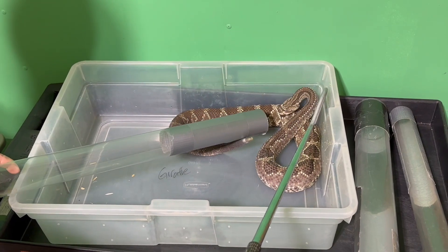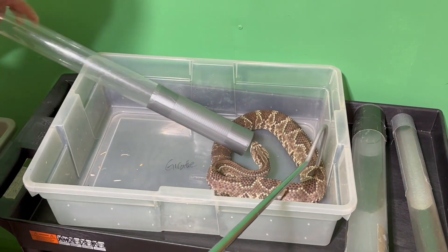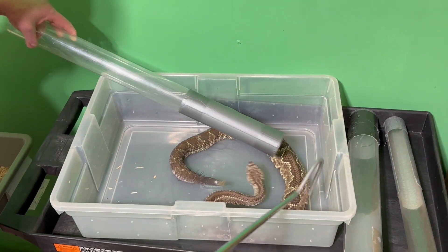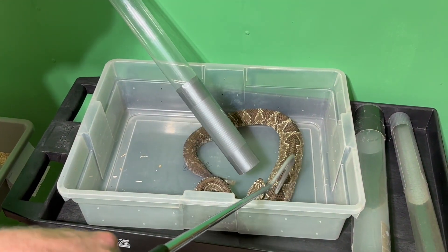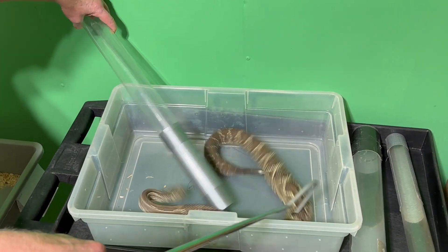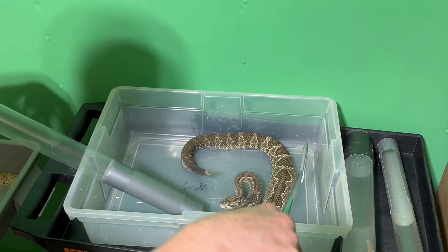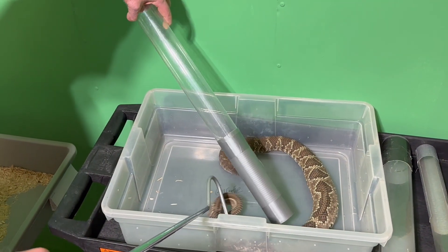You can see this venom is pretty clear. In some populations — this being one in Brazil — these snakes have a clear venom; that's just how they are. All terrificus have a very high neurotoxin, and this venom is actually being used in Europe for cancer research on leukemia and lymphoma. Now this particular snake was not very cooperative. You can see it had some strikes, and there are actually a few more before it gets in the tube.